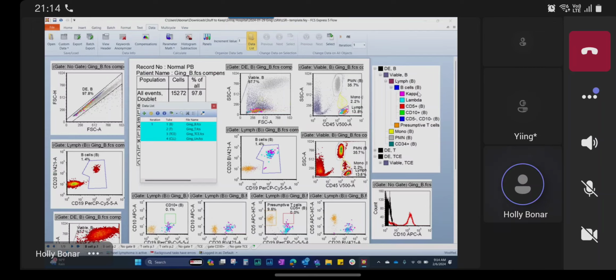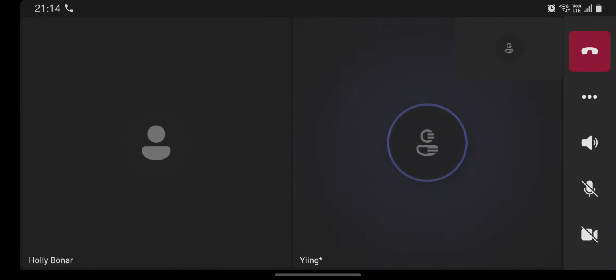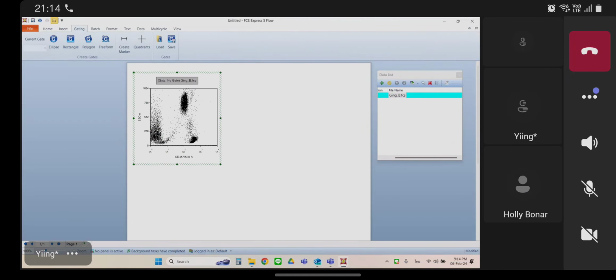So I'm wondering then, and I can unshare if you want to reshare again, but go ahead and open up that layout again that you showed me. Okay. All right. Okay. No, go back to your actual layout. Again, please. Go back.